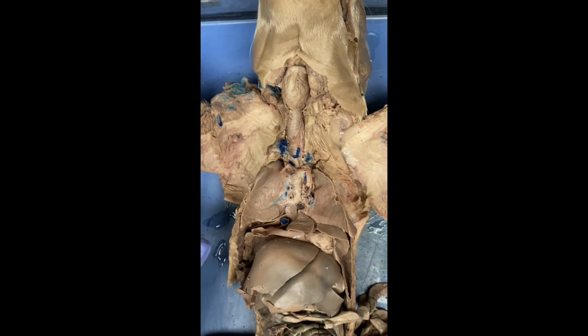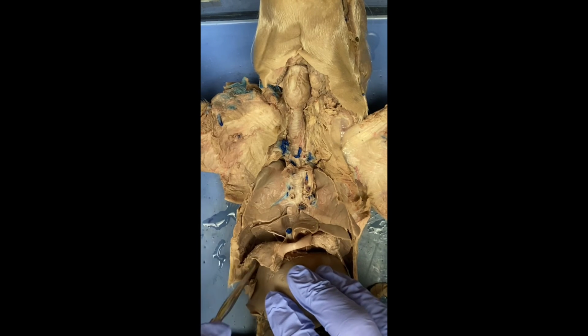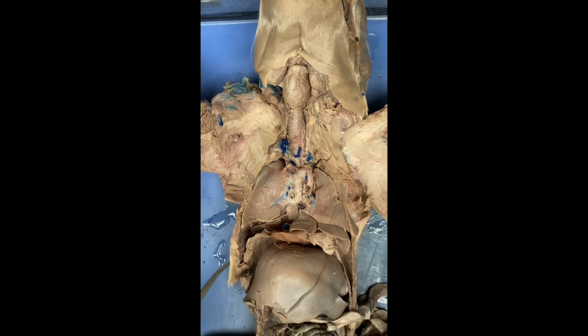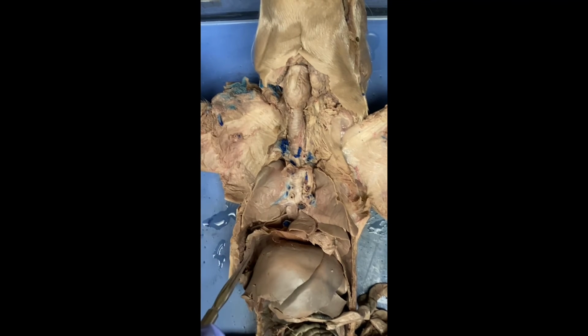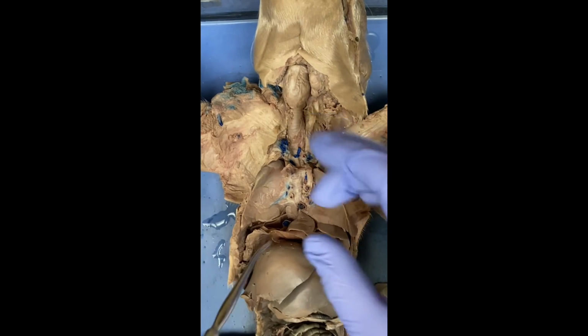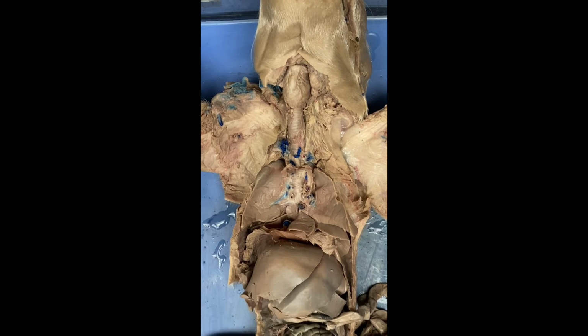Next, we're going to have the diaphragm, which is going to be this thin muscle right here. This one's kind of been mangled a little bit, but this is the diaphragm right here. And the job of the diaphragm is it draws air into the chest cavity. It actually moves up and down, so it makes the thoracic cavity larger, which, due to pressure differential, has air going in. So this is pretty much what allows the animal to breathe. And compared to turtles, which had to move limbs to be able to breathe and had a lot more complex method, pigs and most mammals just have a diaphragm.